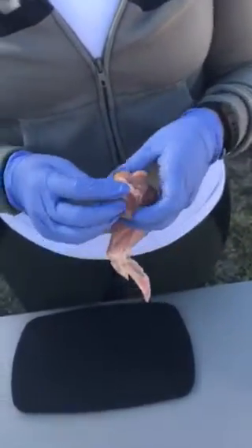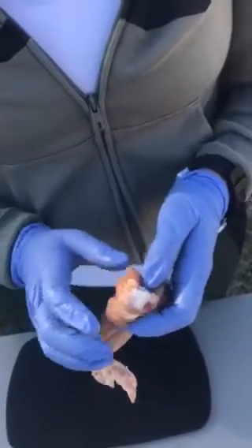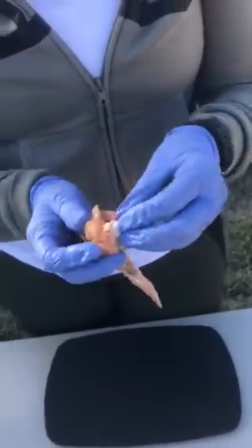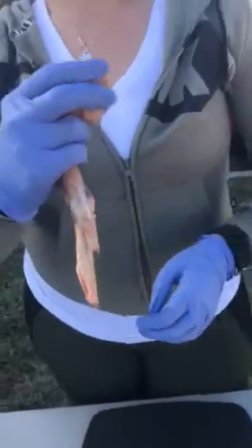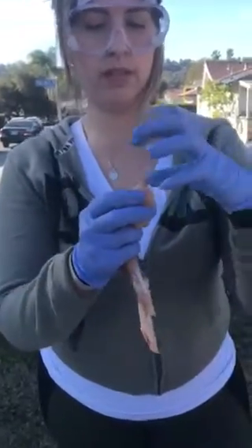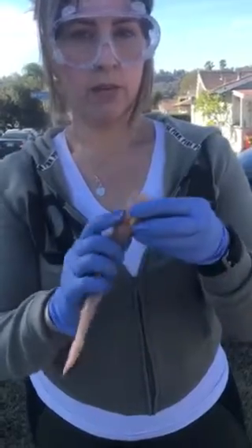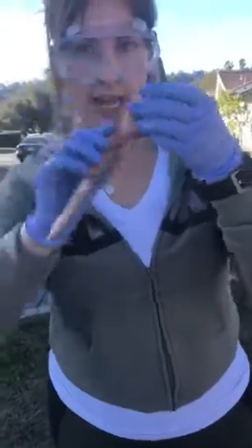First, I'm going to show you the synovial joints. This one is the ball and socket joint. This is the ball part where the arm connects to the rest of the chicken's body, and you would find the socket on the other side. This joint helps with rotating, as well as abduction and adduction.